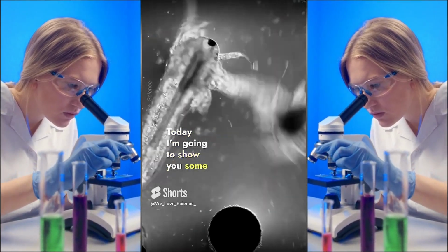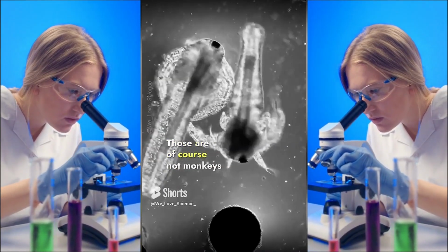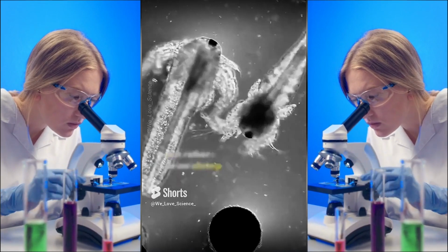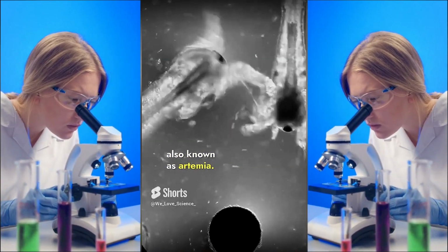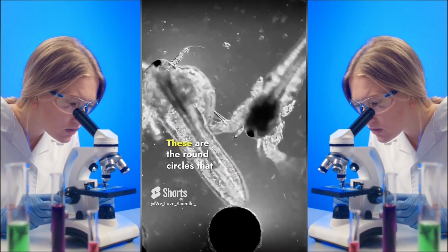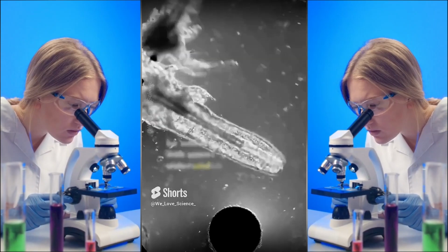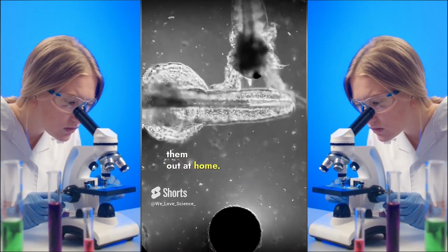Today I'm going to show you some sea monkeys that are put under the microscope. Those are of course not monkeys but rather brine shrimp, also known as Artemia. And you can buy them in the form of tiny little eggs. These are the round circles that you see here, and those eggs can be added with some water and then you're able to hatch them out at home.